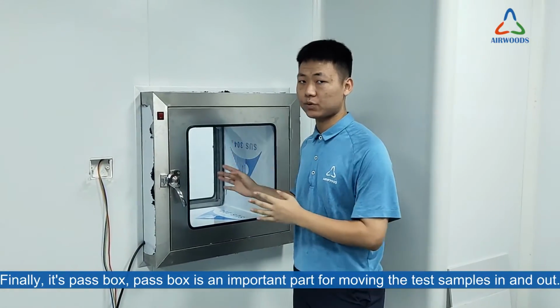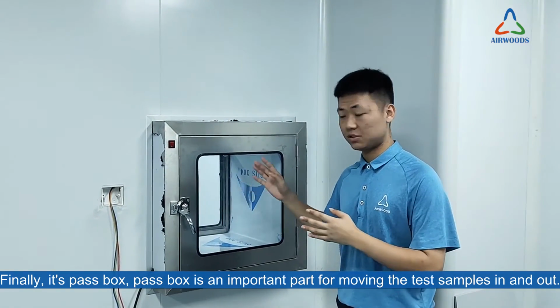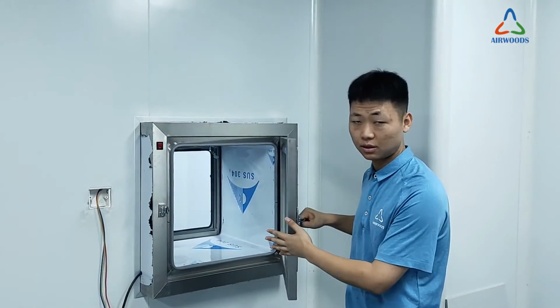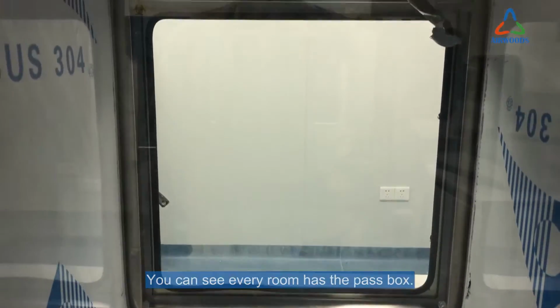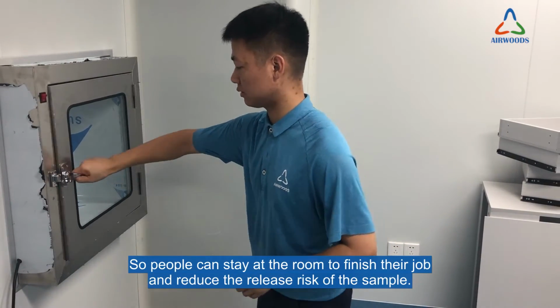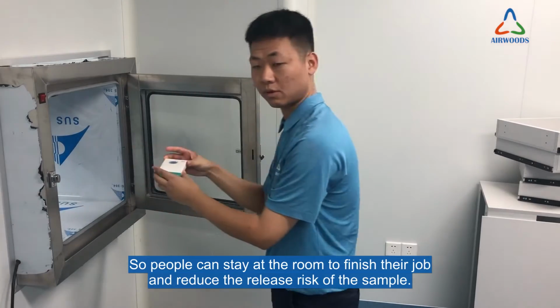Finally is the pass box. The pass box is the most important part for moving samples in and out. The pass box is used as the channel for moving infectious waste to the outside. You can see every room has a pass box, so people can stay in the room to finish their job and reduce the release risk of the sample.